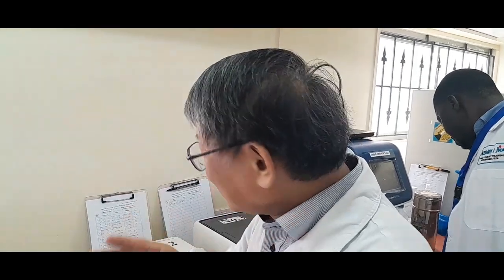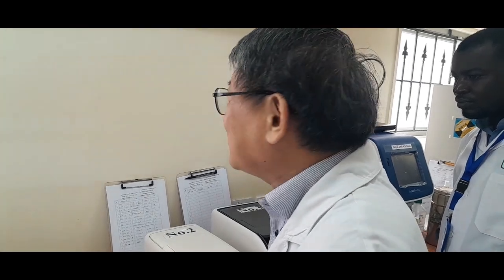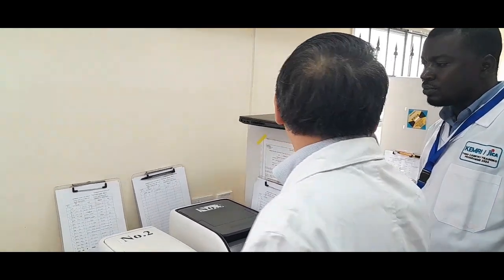I think this is a global issue. But every single laboratory encounters that the person who broke something never reports it. They just silently leave because they fear charges.